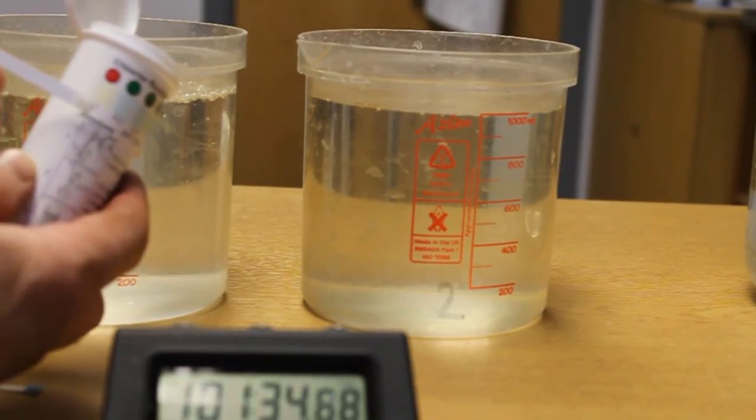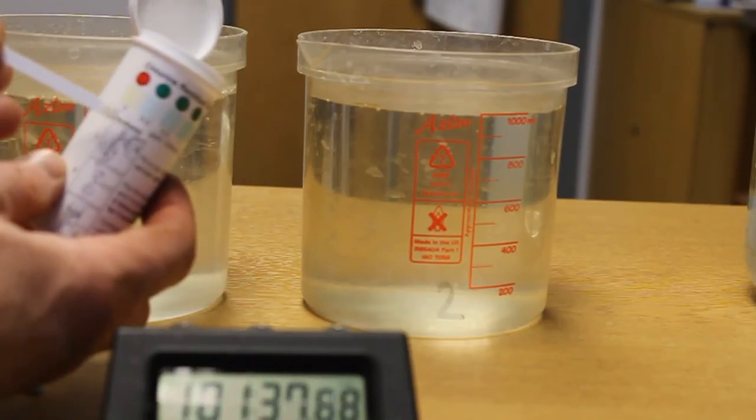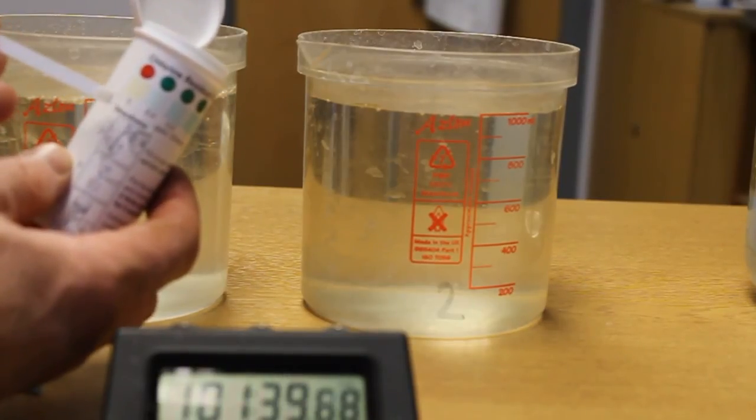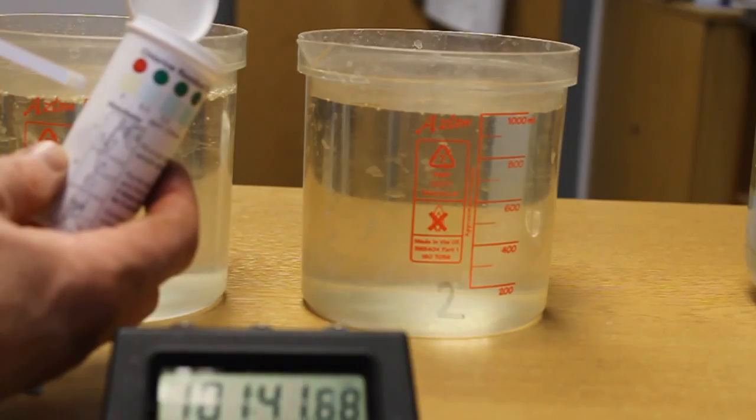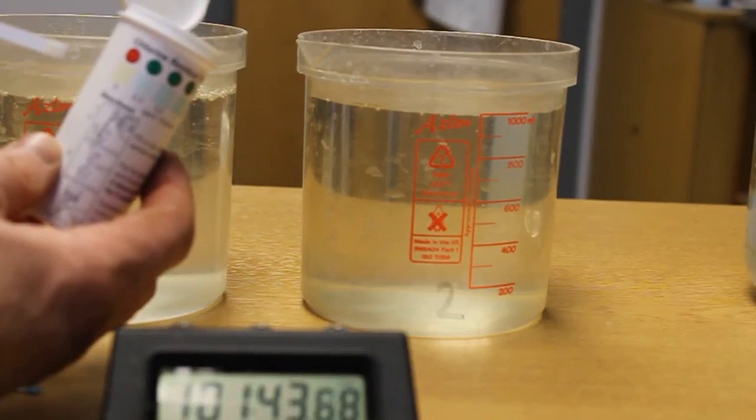So if you do get no colour like that, or anything less than the colour of 0.3, you know that the dose isn't high enough and you should use a slightly higher dose.